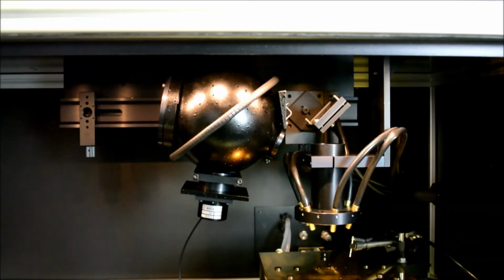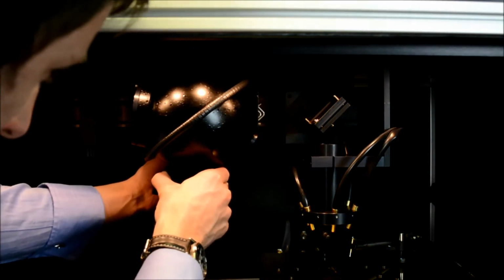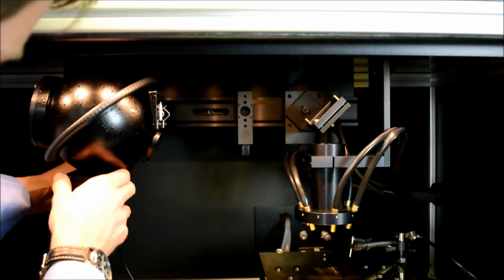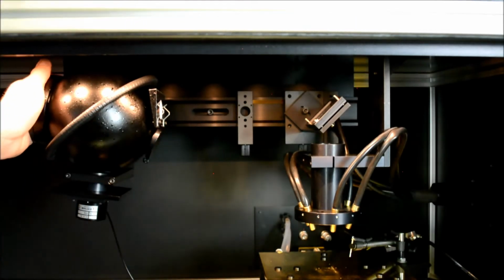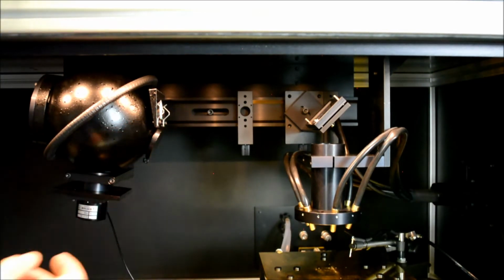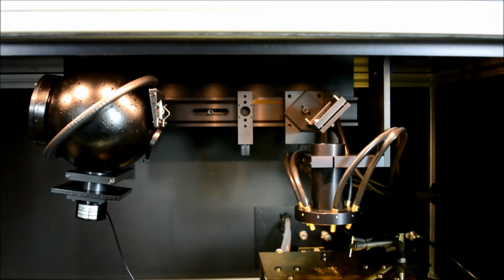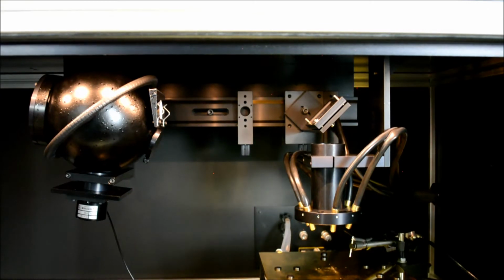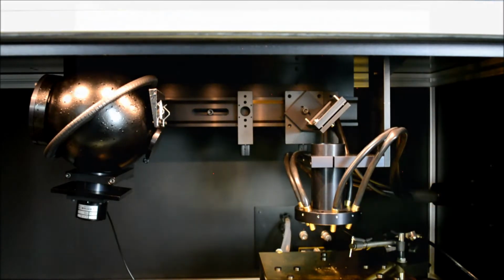To perform a measurement of spectral transmittance, the DTR6 should be moved to the left-hand stop of the optical rail. I have placed the reflectance port cover at the reflectance port and the small set of clips at the transmittance port. We can now perform a measurement of the reference level with no sample in place.